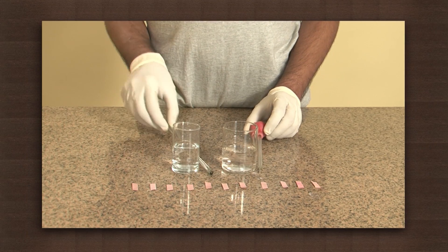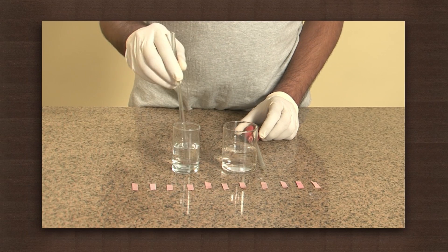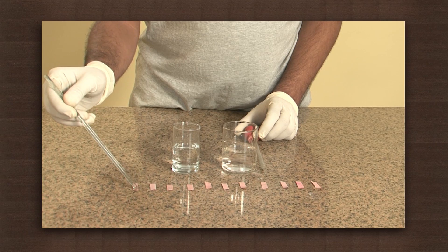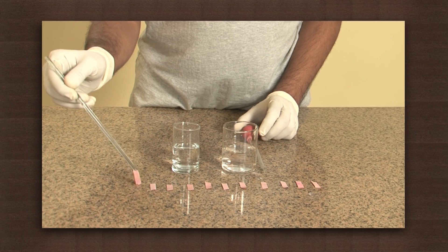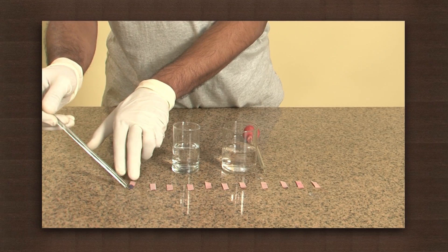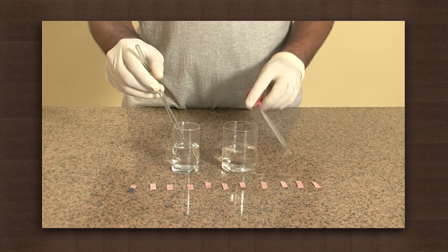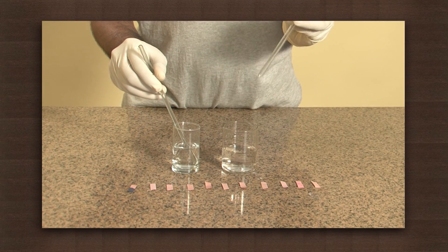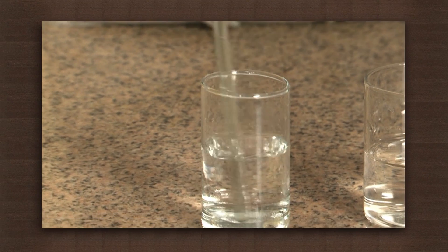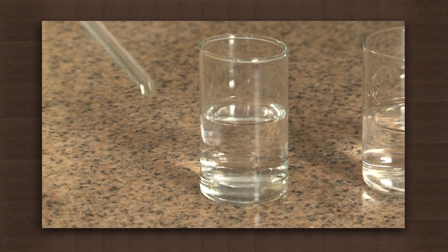The chemical name of caustic soda is sodium hydroxide. Let us confirm that it is a base using this red litmus paper — the paper turns blue. Now with the dropper, add hydrochloric acid to the soda solution drop by drop. Stir the solution after every drop and check if it continues to turn red litmus blue.